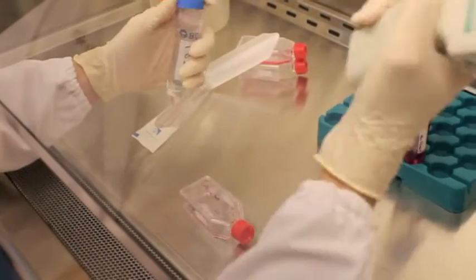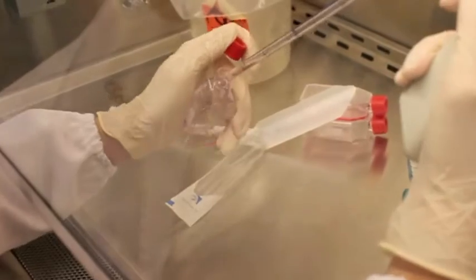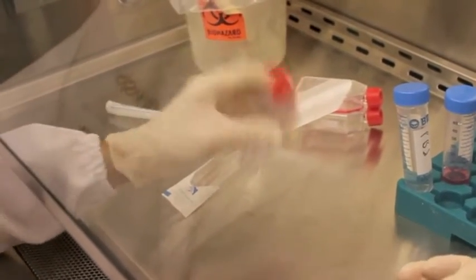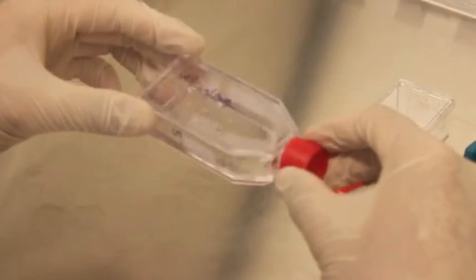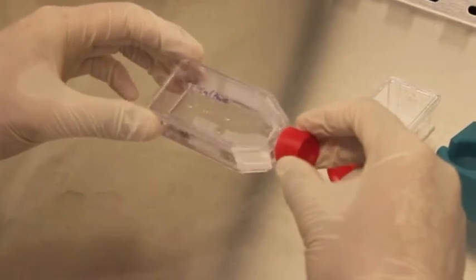After emptying the media, PBS is added to wash the cells. During the washing process, do not shake the flask vigorously as shown. Instead, tilt the flask back and forth gently to perform the washing.